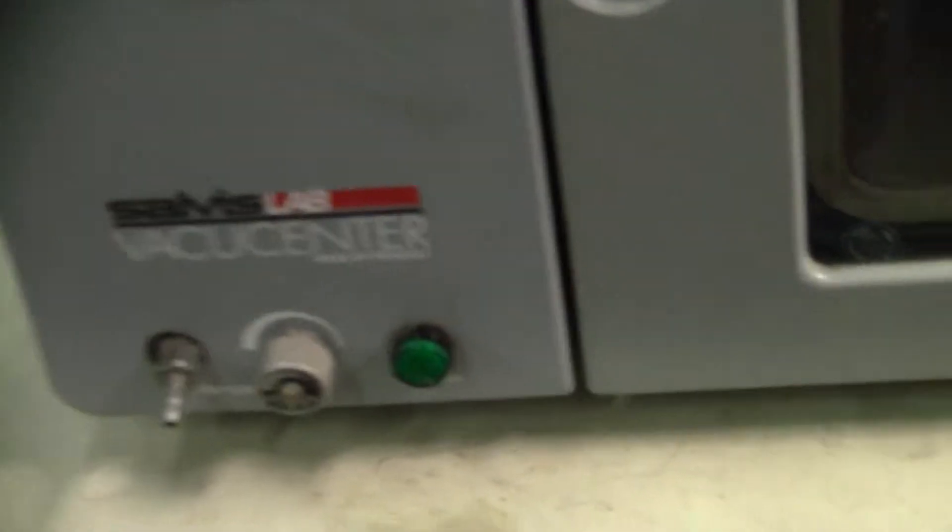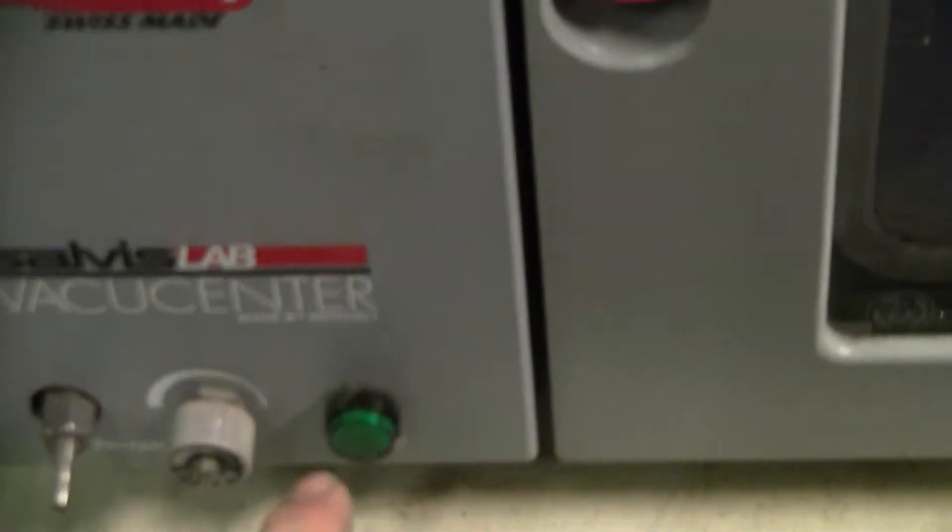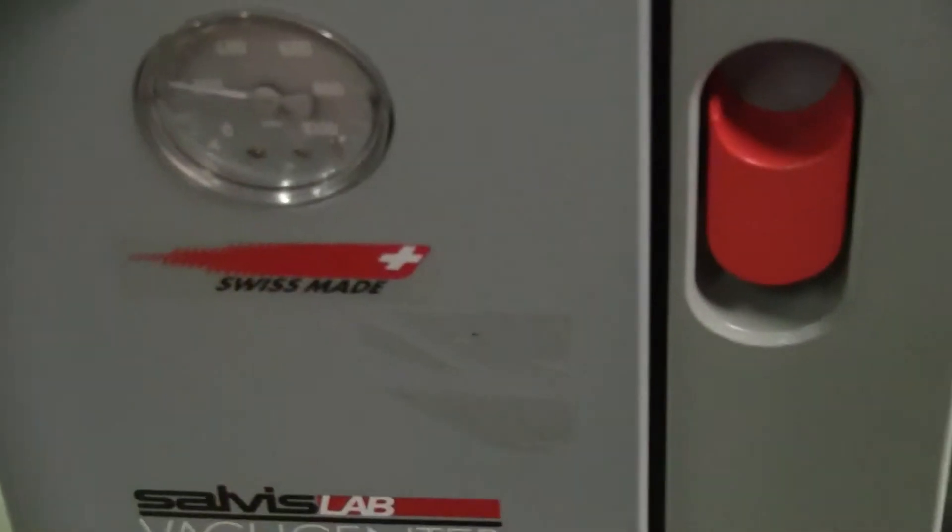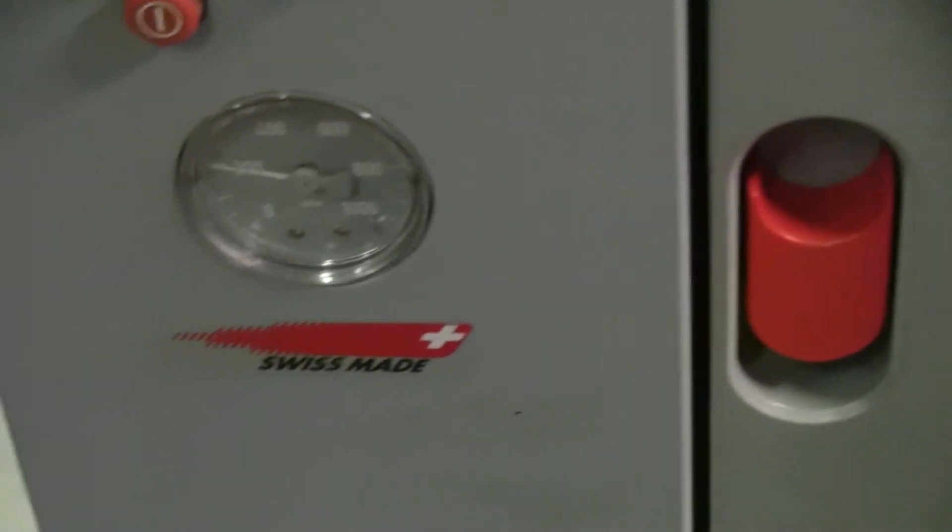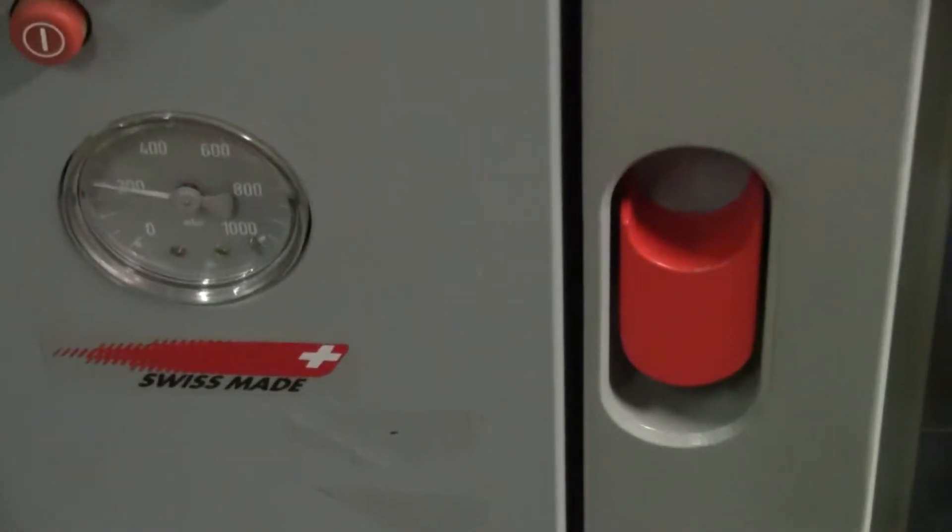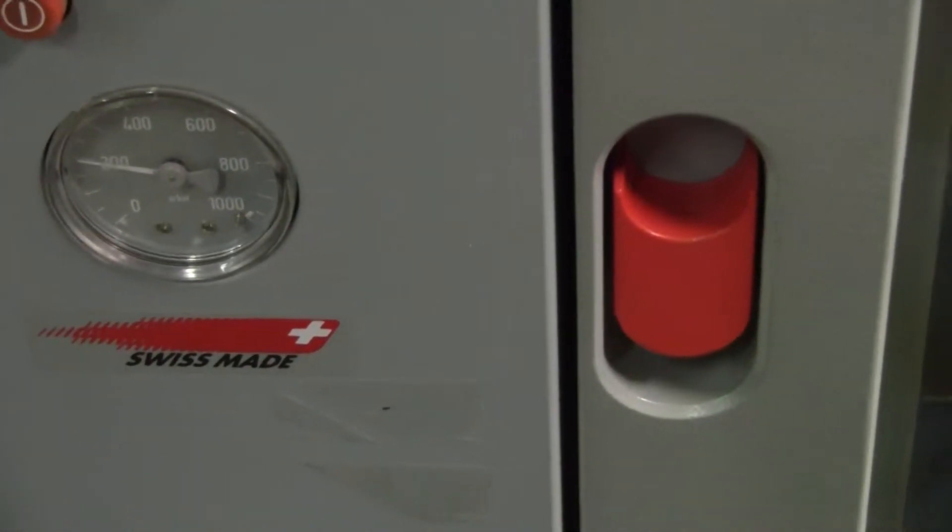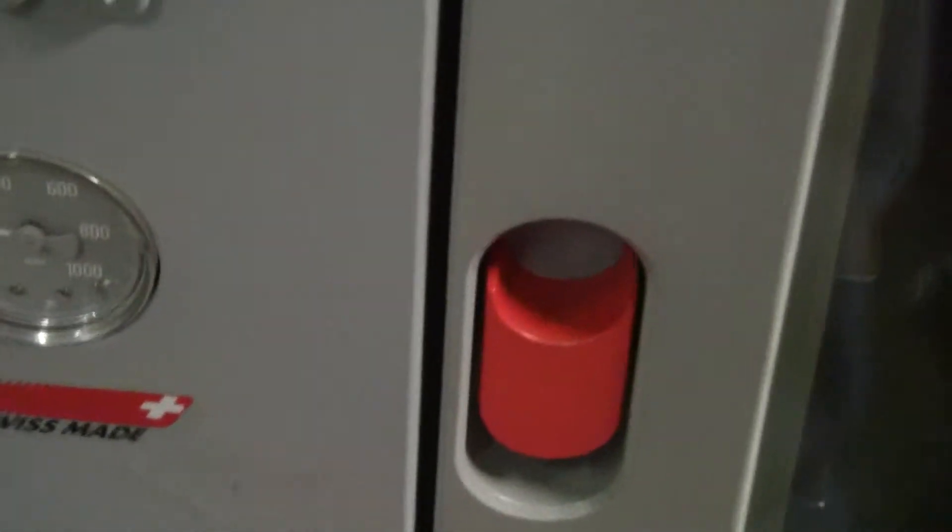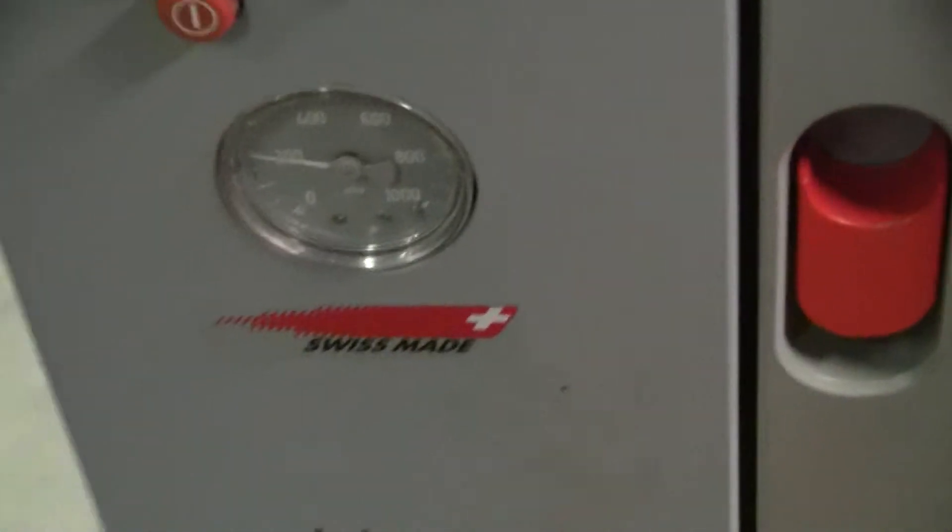Buttons on the bottom. This is a solenoid valve which shuts the vacuum off or allows it to be on. So I'm just going to tap it real quick.